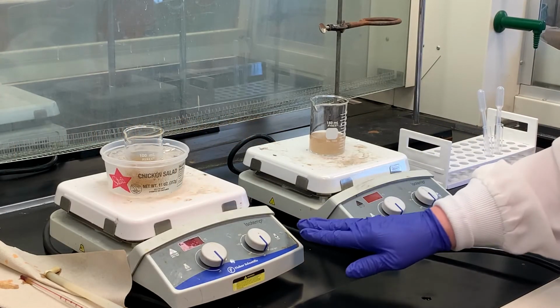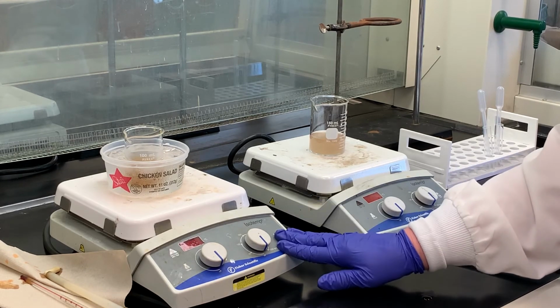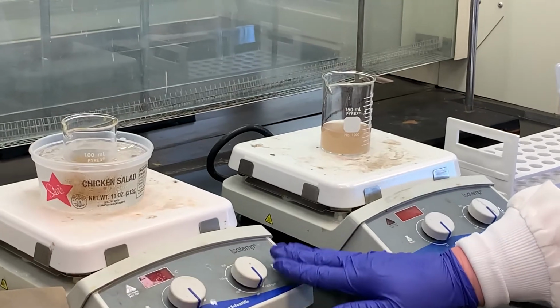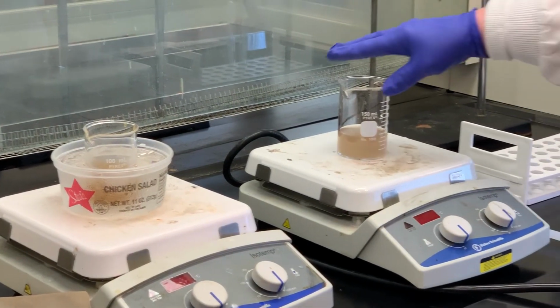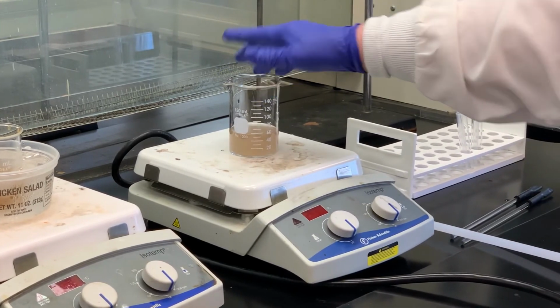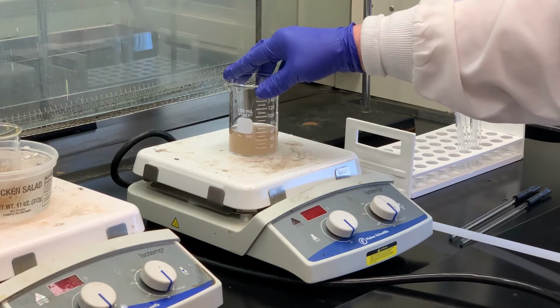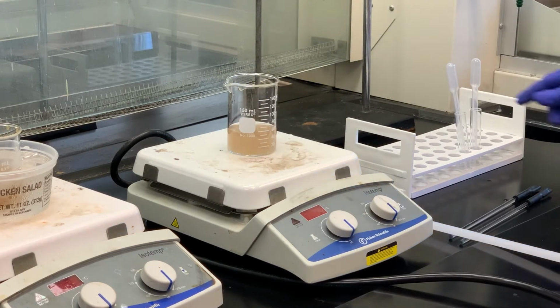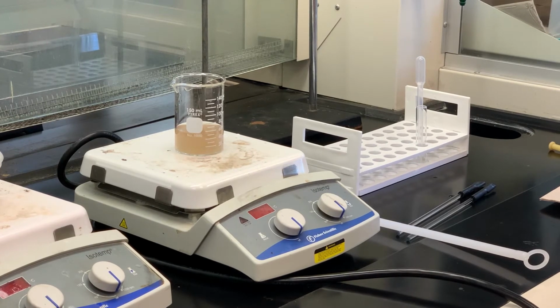So it's been 15 minutes of stirring the diazo component with the sodium nitrite, HCl, paranitroaniline. And over here, I made the solution of the 2-naphthol dissolved in the 50 milliliters of 10% sodium hydroxide. So the first thing I want to do, and we're not doing a percent yield or calculating how much we got, but I just want to show you how you can actually make the dye stuff.